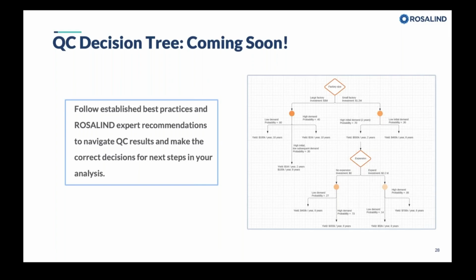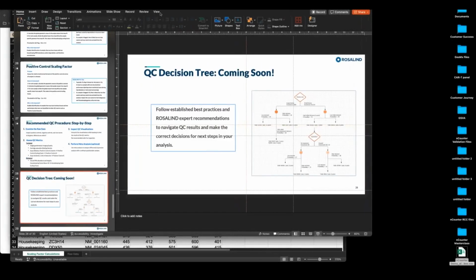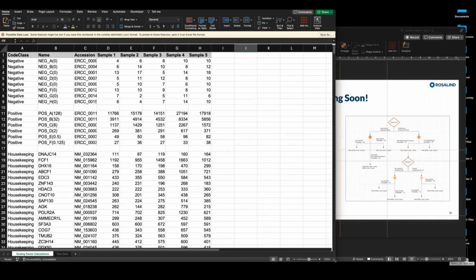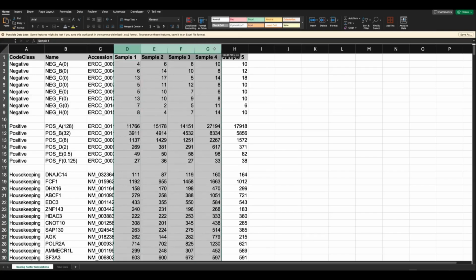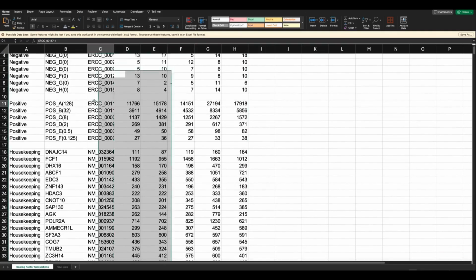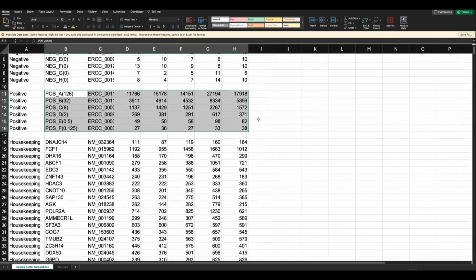Okay, so I'm going to jump out of here. Looks like we have 10 minutes left to do a quick show within Excel and then the Rosalind platform. So this is some data showing us raw counts in these 5 hypothetical samples. I want to talk about those positive control scaling factor and housekeeping gene scaling factor metrics. So the math is the same. I could be performing the exact same thing on positive controls, but for the sake of time, I'm going to show you what it looks like on the housekeeping genes.